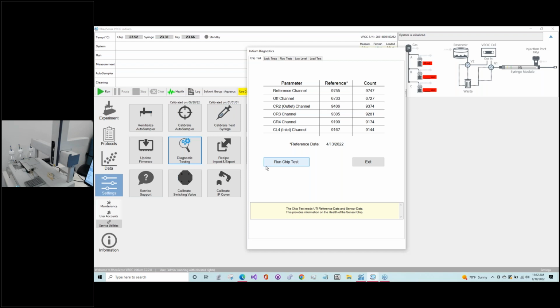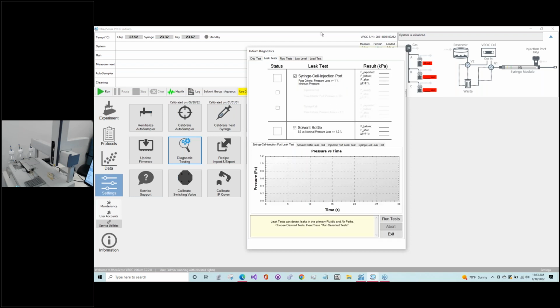So once our chip test is good and our sensors look okay, we will go to our leak test. Okay, so we have both of them checked, so we will run both. For the leak test, you'll notice the top one refers to the syringe cell injection port. This is mainly looking for any leakage of the injection port, and we'll talk about what might be happening if this is failing. The main thing we're looking for in that first leak test is whether this injection port cover is seating properly. And there's an O-ring in here, which we'll talk about when we're discussing changing out your consumable parts.